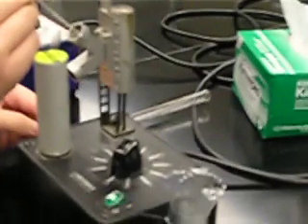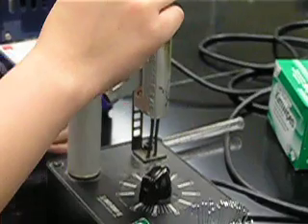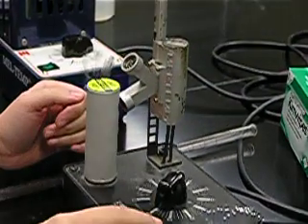And just take it over to the melt temp apparatus and put it in this slot right here. This slot can actually hold more than one sample. And turn it on.